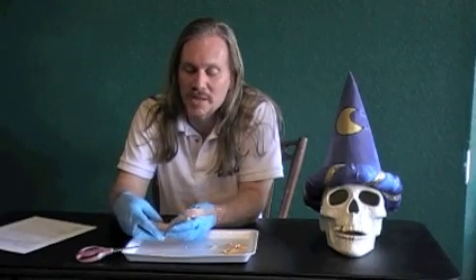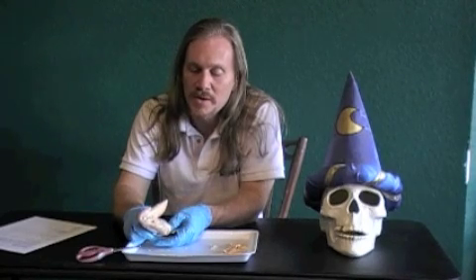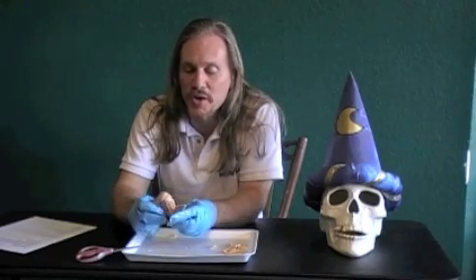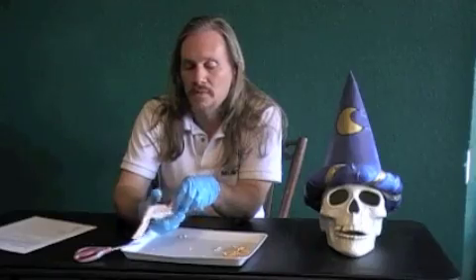These are analogous to our biceps and triceps. If you pull on the bicep, it flexes - so the bicep is a flexor. Watch: pull, it comes in, so that is a flexor. The extensor here - once it's already in - you pull on that extensor and it goes out. Pull, it goes out, just like that. So that is an extensor: that one extends, this one flexes.